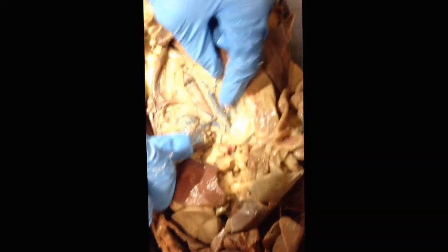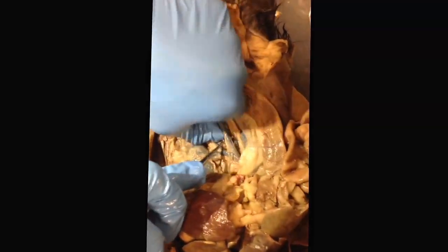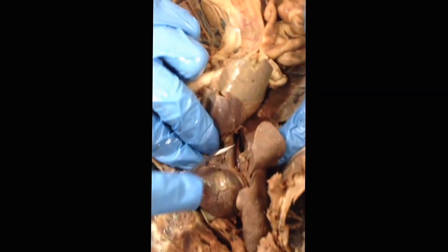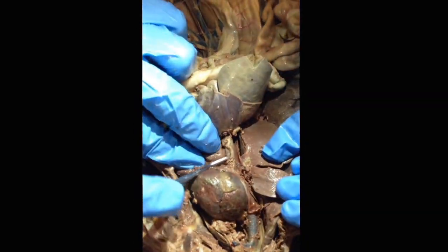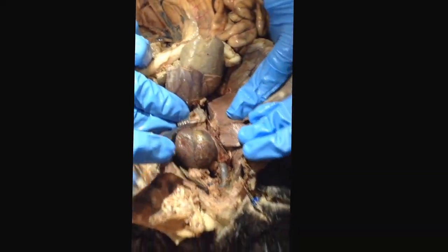Next thing on the list is the caudal vena cava, and that's a pretty easy one to see. That's the major vein that connects the rest of the body and the two legs on either side all the way back up to the heart. And you can see that it's underneath everything, and it's that blue blood vessel. A little bit obscured in this one, but you can pretty clearly see the tube there. The color is a little bit obscured.